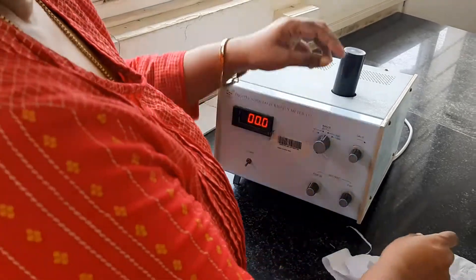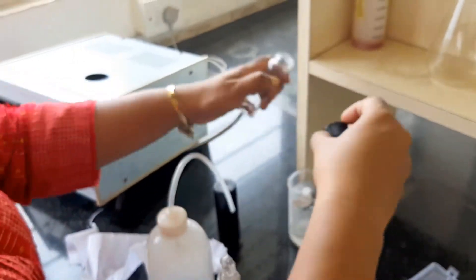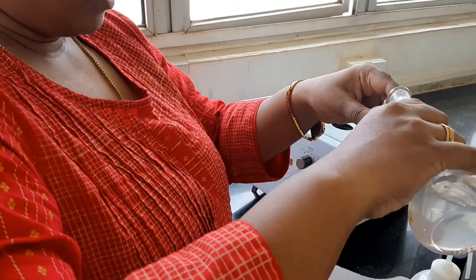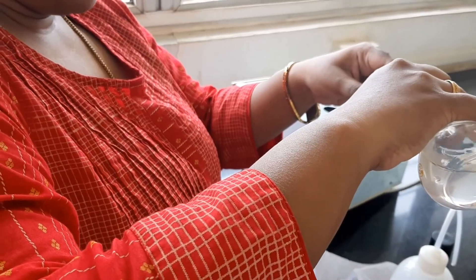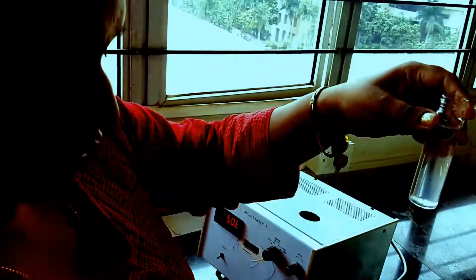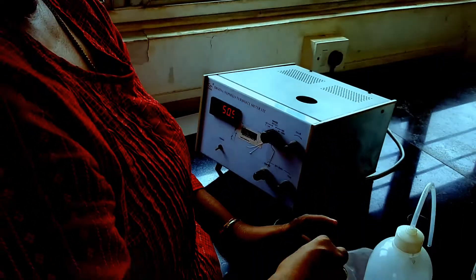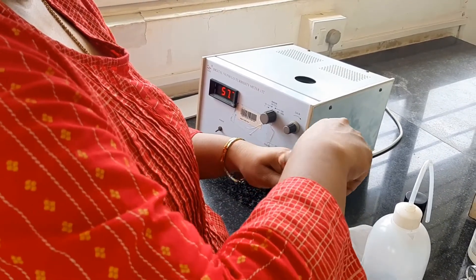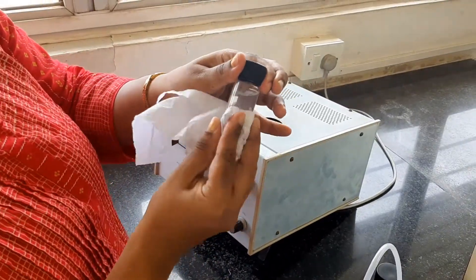The next I will be using is a known solution. This is a known solution of 40 NTU — NTU is Nephelometric Turbidity Unit. You can see it is not a very clear solution; it is turbid. Turbidity is due to the presence of small colloidal particles in water.